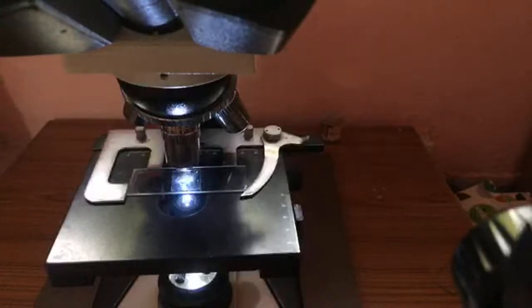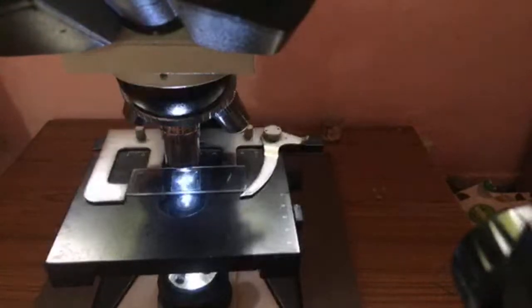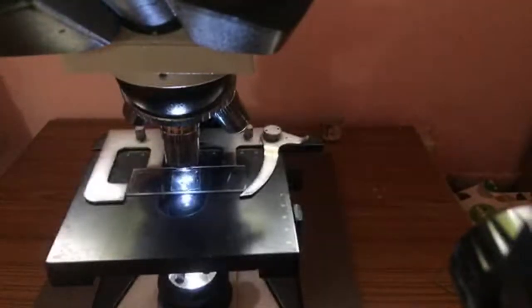Okay, so we're live. People, Sunday, 10th of October 2021, another session of microscopy.